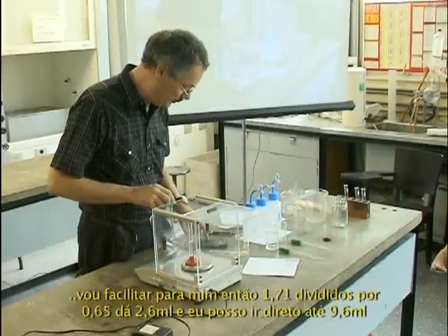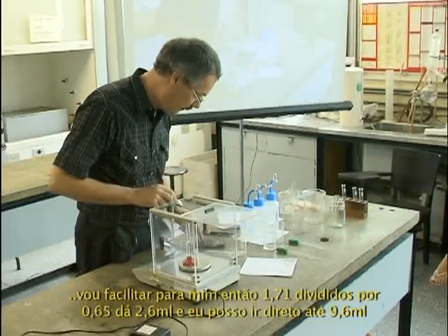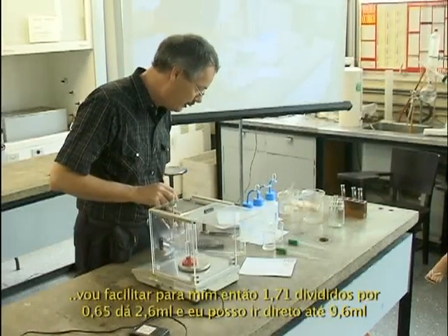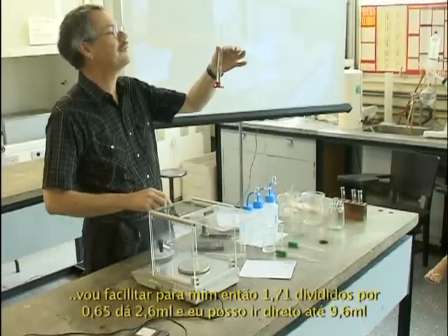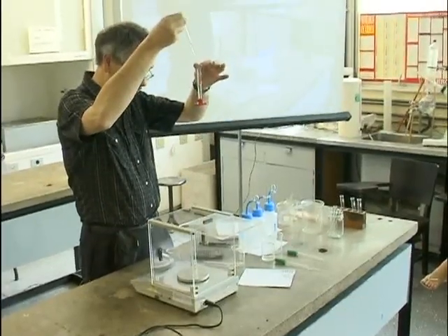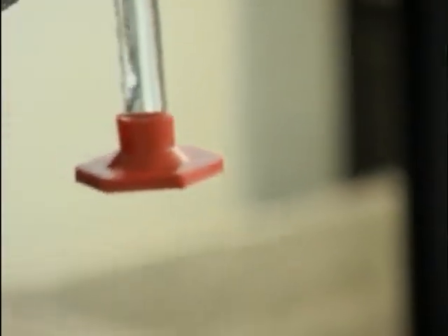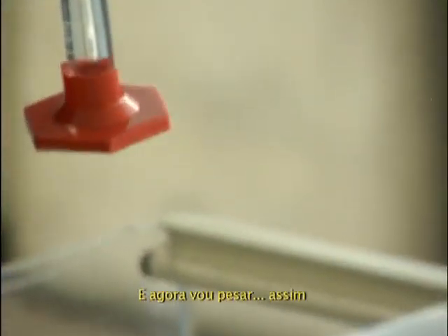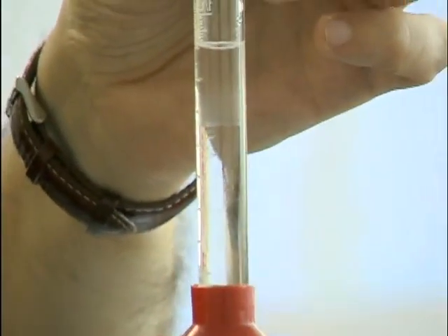I'll cheat a little bit. 1.71 divided by 0.65 makes 2.6 milliliters. So I can go right away to 9.6. Oops. 9.6. And then I'm going to wait. There. Okay.